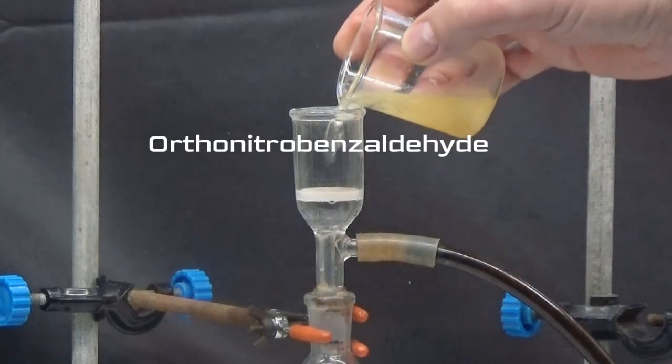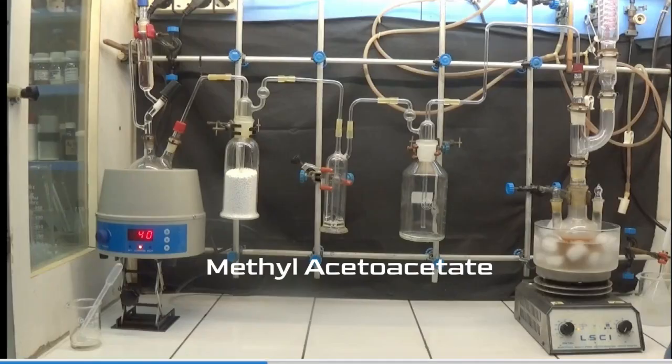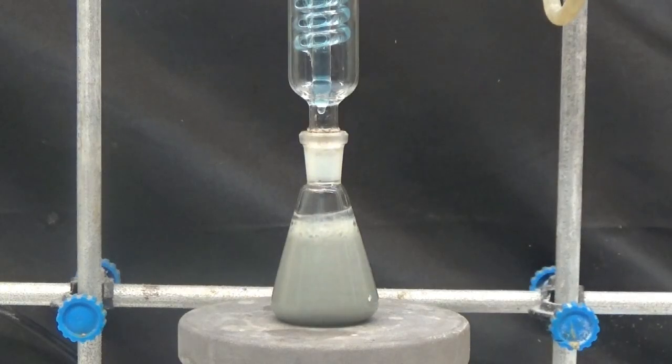In previous videos we have seen the synthesis of orthonitrobenzaldehyde and methyl acetoacetate, which are precursors in the synthesis of nifedipine. In this video we are going to see first how to obtain nifedipine and then how to purify it.